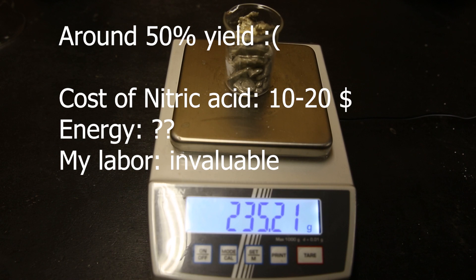So the yield is actually terrible with around 50%, and if I take in the cost of the nitric acid and energy, it will probably be close to even. Since I got more than what I paid for, and I can resell the bottles, I'm honestly not too mad about it.